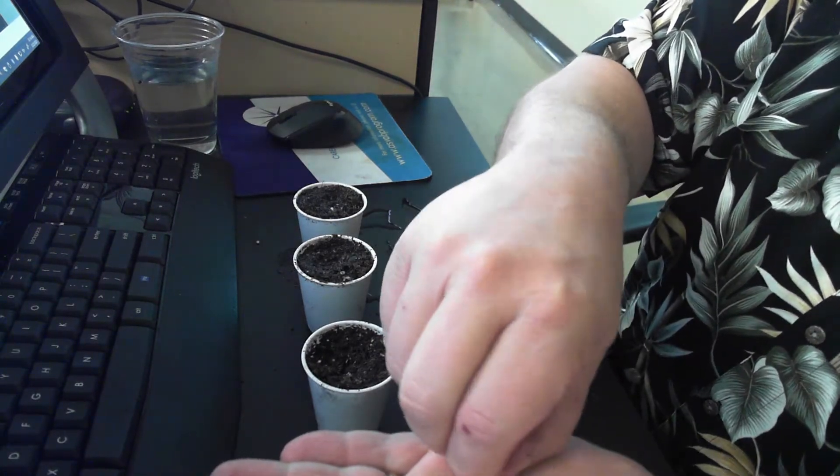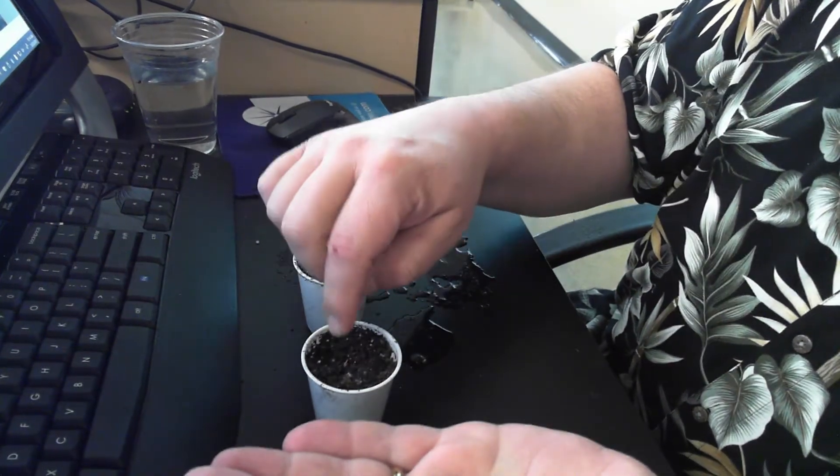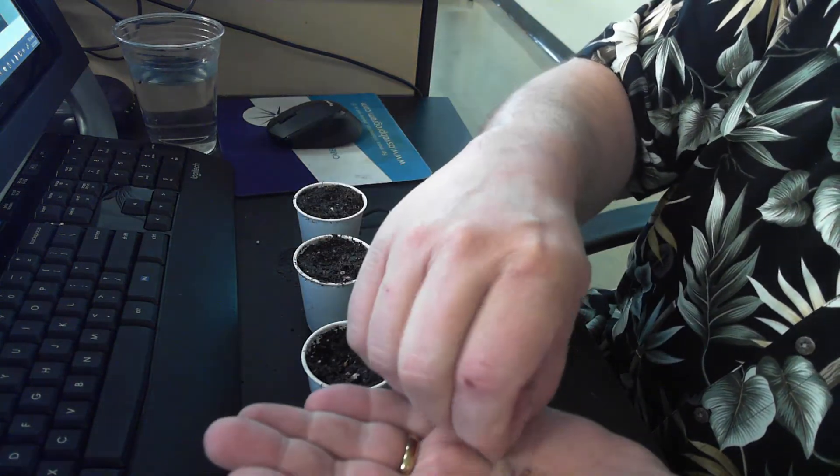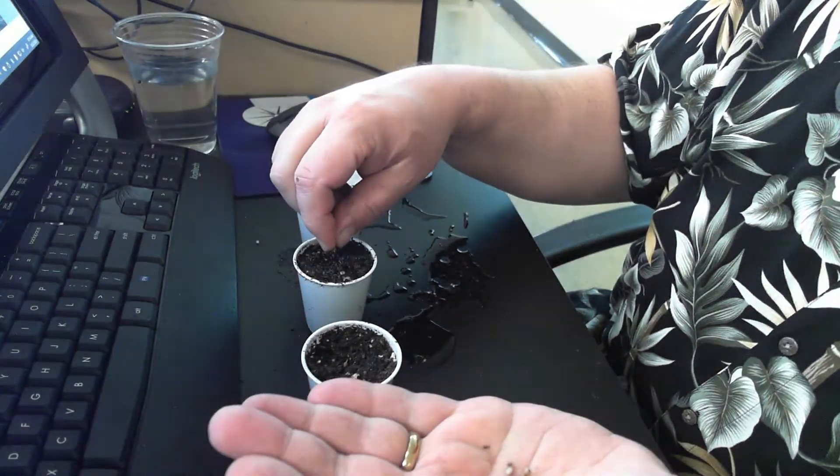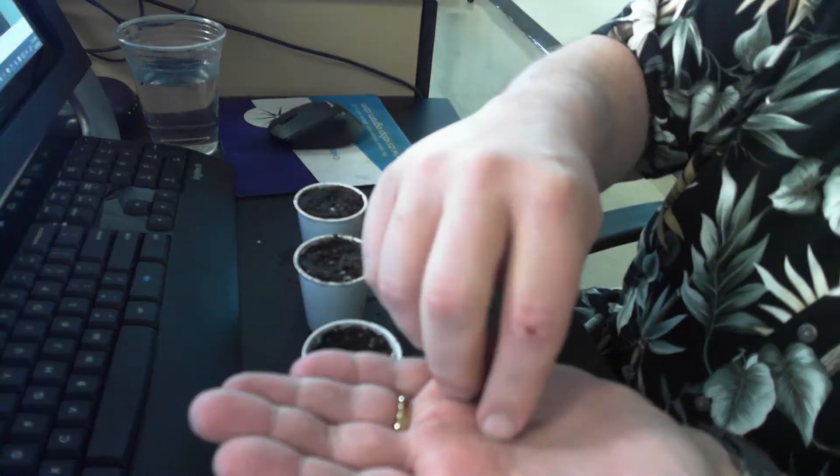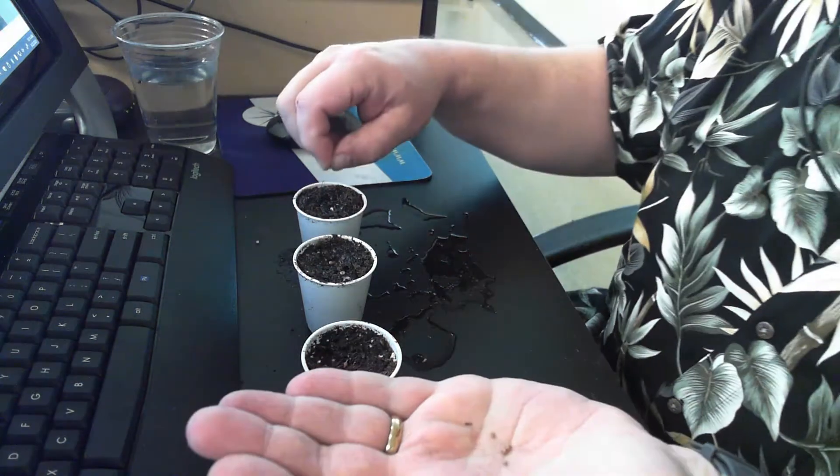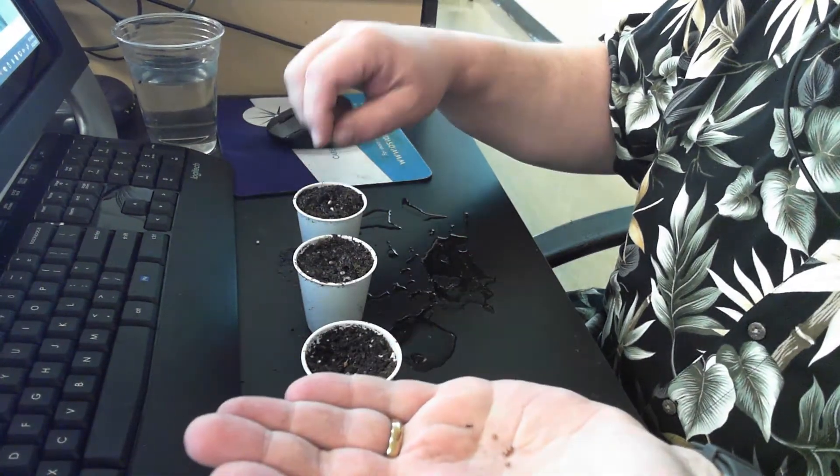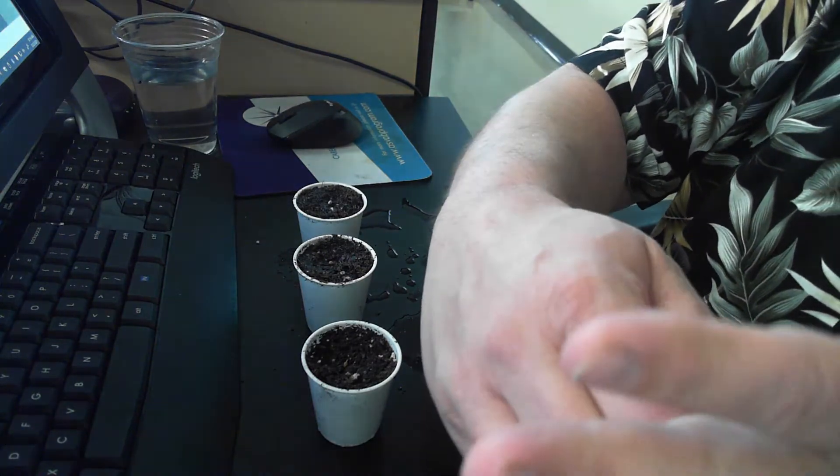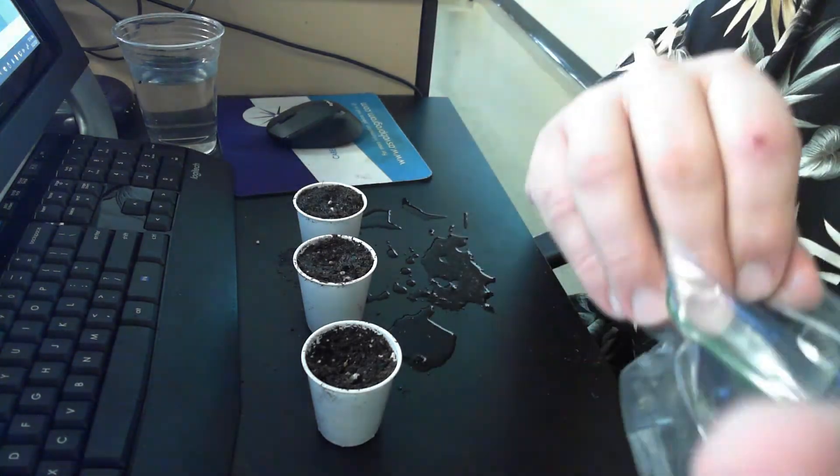So, I'm going to take a seed. I'm just going to set it on top there. I'm going to take a seed and set it on top here. I'm going to take another seed and set it on top there. I'm going to put the rest of my seeds back in the bag for another lab.